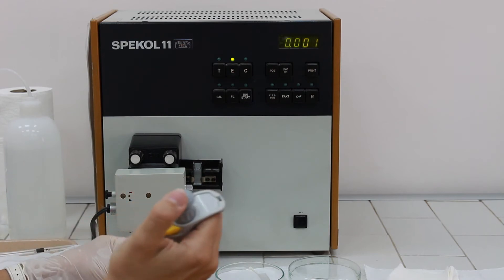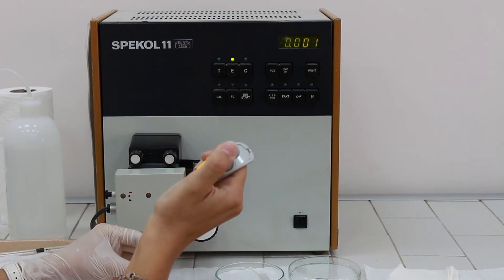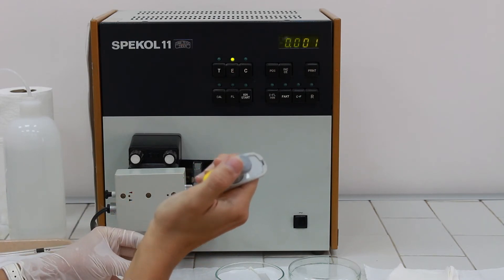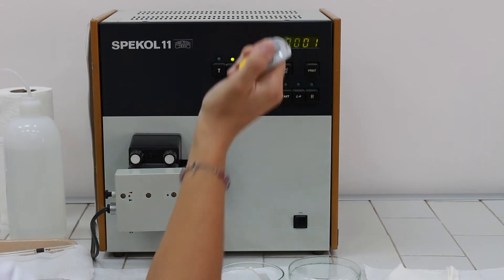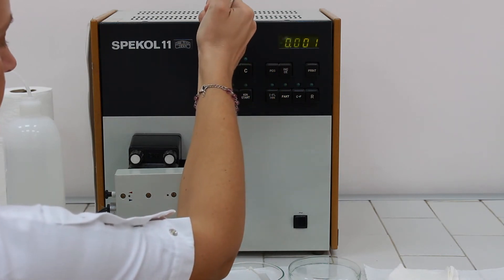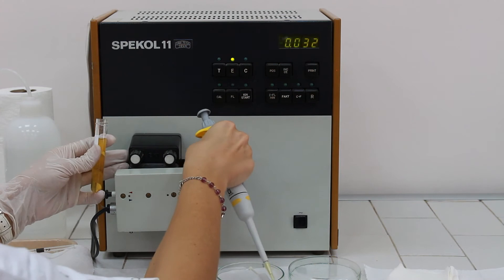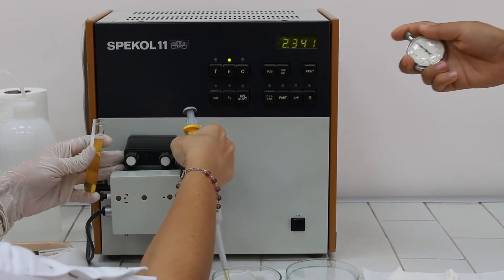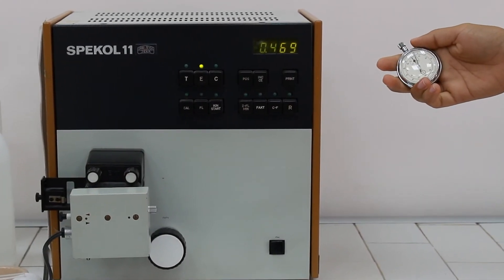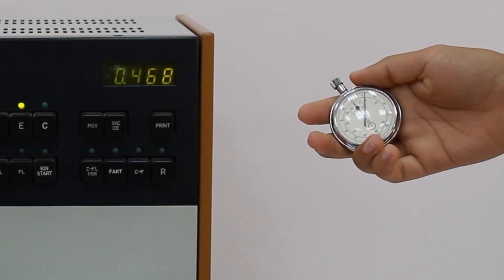Add 80 µl of serum sample. The working wavelength is 340 nm. Start the timer and read the absorbances for 3 minutes, each minute.